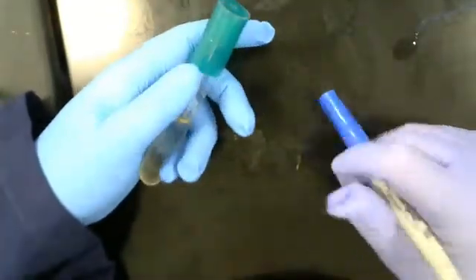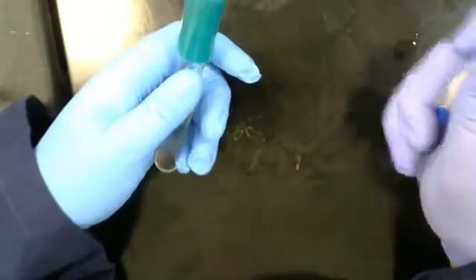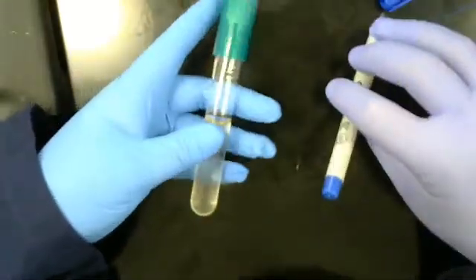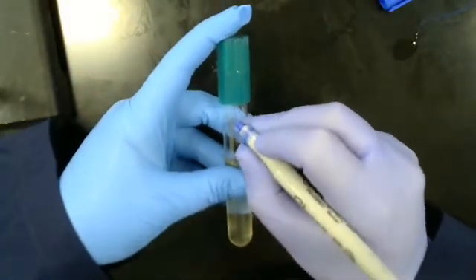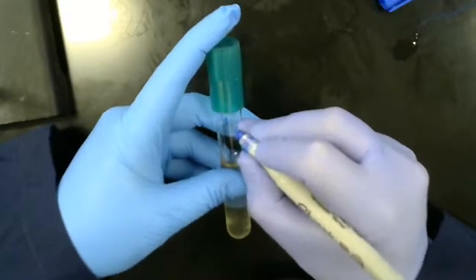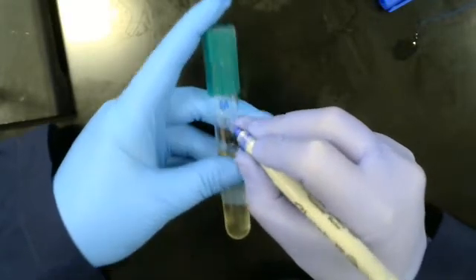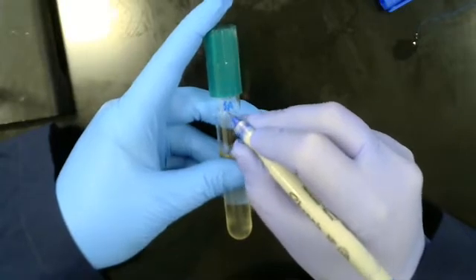...whatever your dominant hand is, your writing hand has your utensil. Whatever is not has the test tube. First things first, you want to put species. Usually on a test tube, this is a two-letter, with the first one being genus, species. So Staphylococcus aureus.